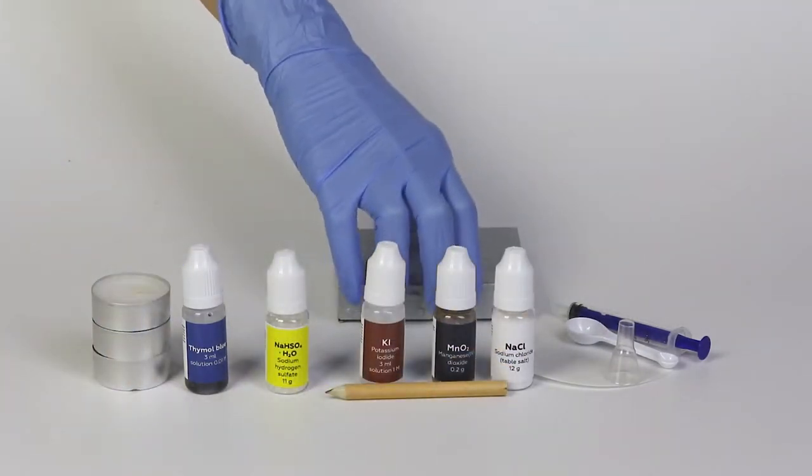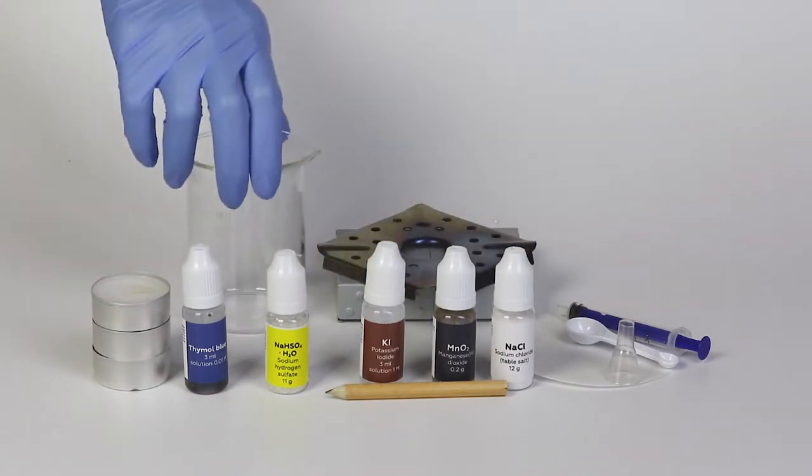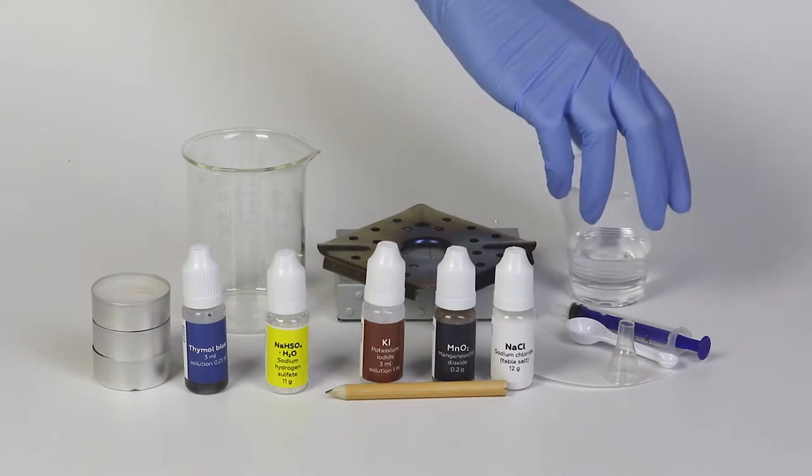From the starter kit, take the stove, the flame diffuser and a beaker. In addition, you will need a glass of water and a lighter or matches.